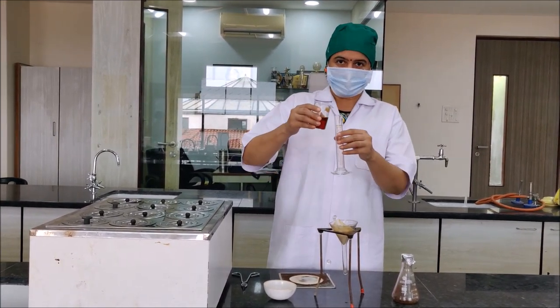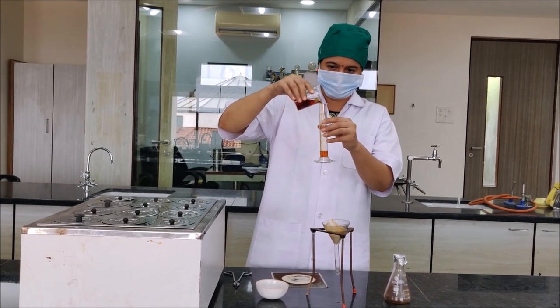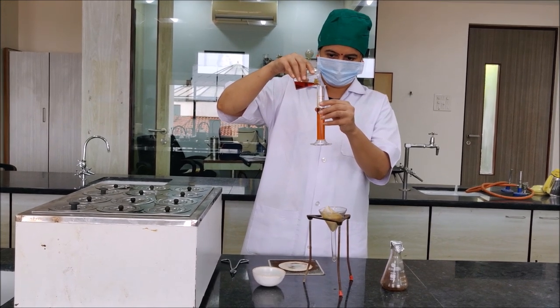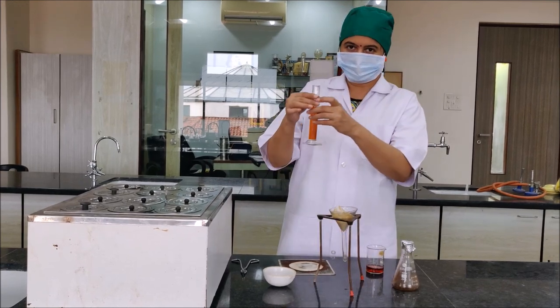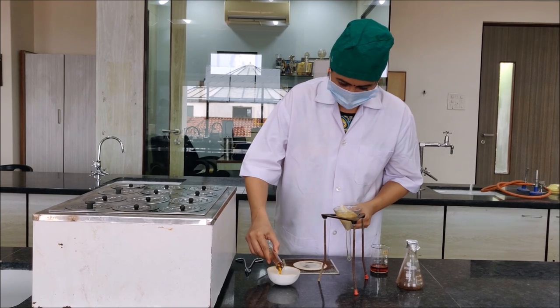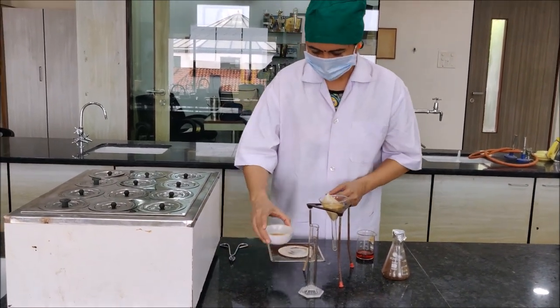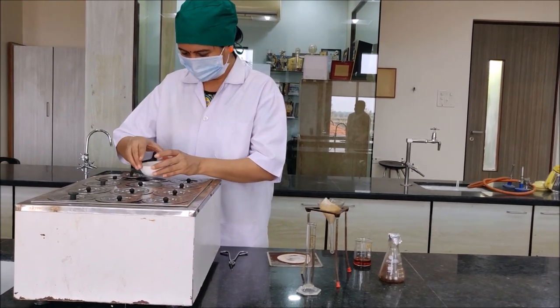Now we will be taking 25 ml of the extract. We have taken 25 ml of extract and we will transfer it to the porcelain dish which we have already weighed. We will then evaporate this extract to dryness on a water bath.